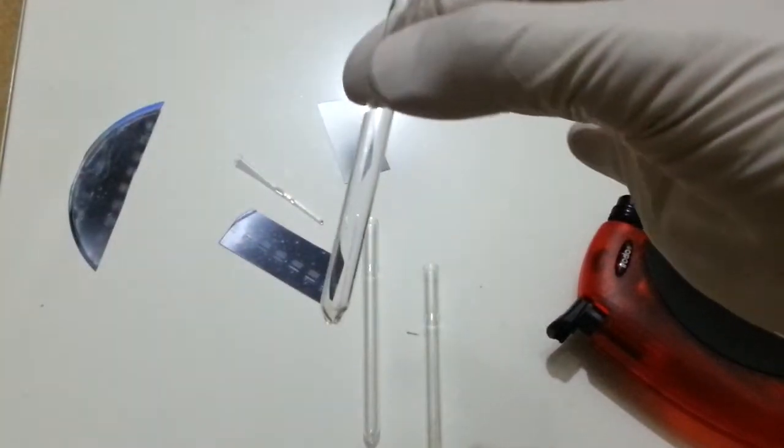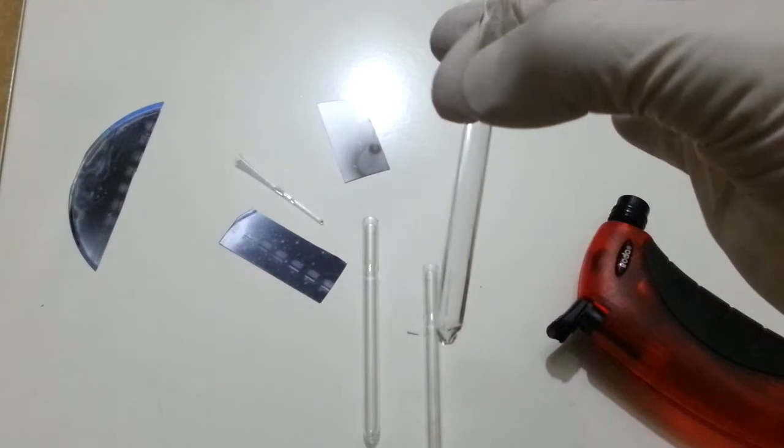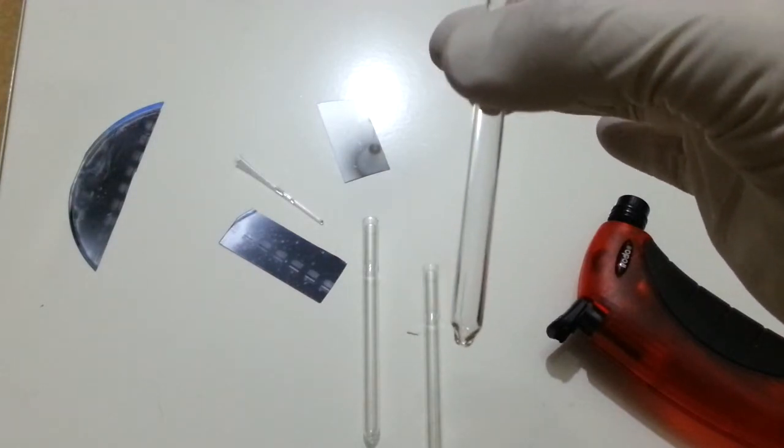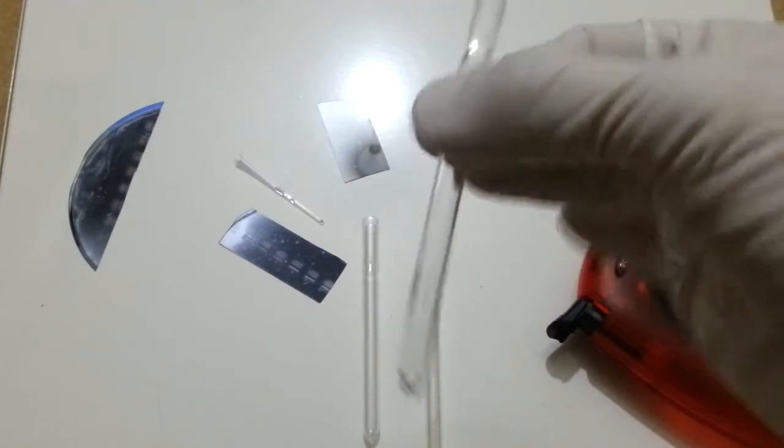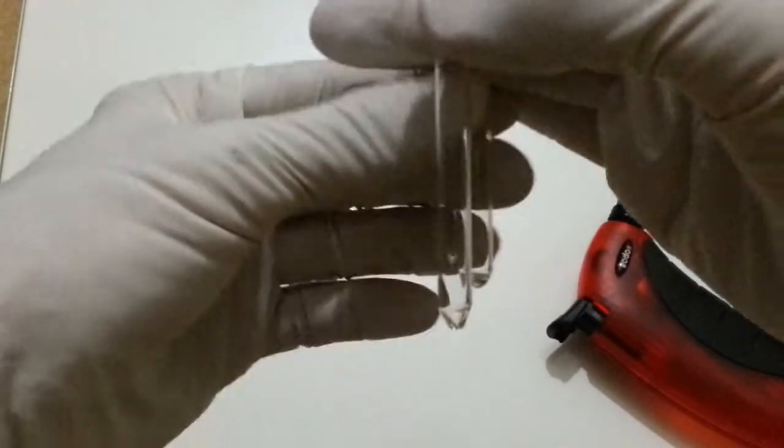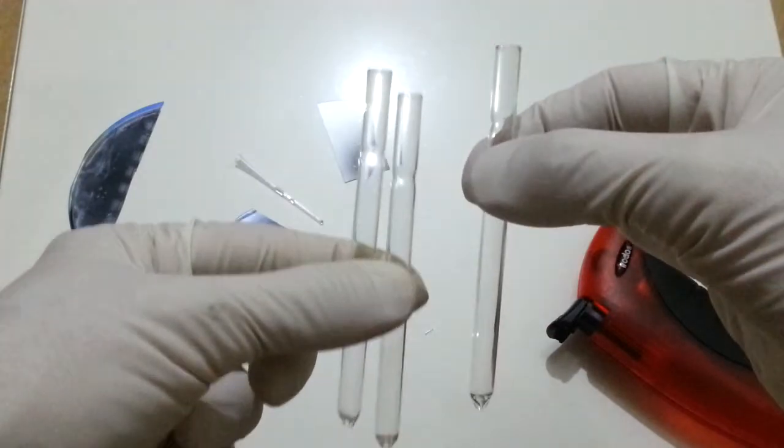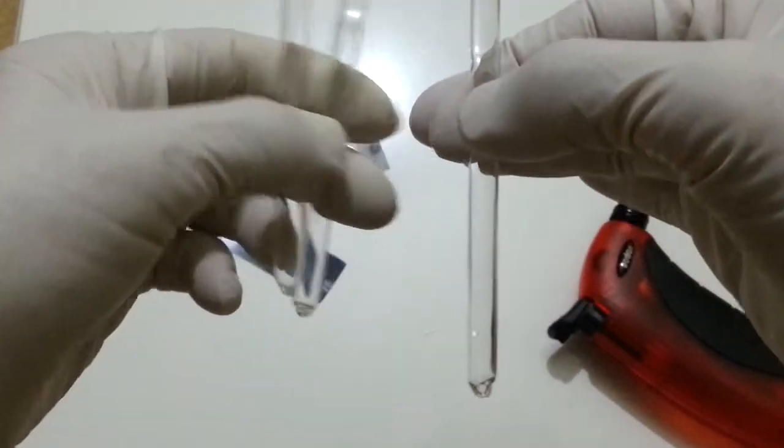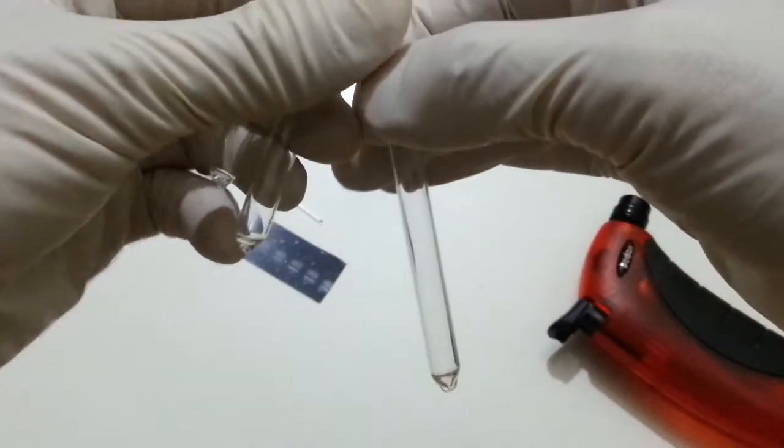And here you go. Test tube made from borosilicate glass, costing almost nothing. And here, this is the third one I have made. Alright, thank you very much for watching. Hope this is going to be useful.